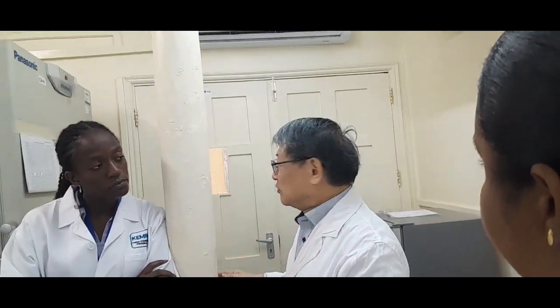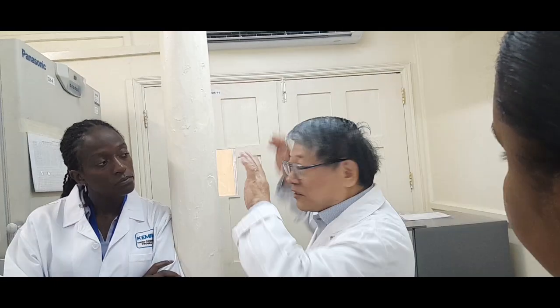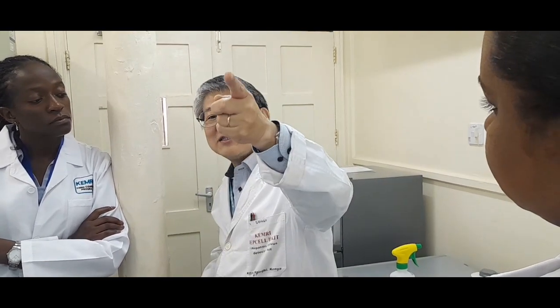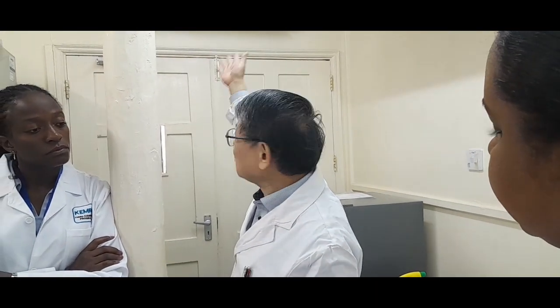Okay, not half capacity. Each one can cover this entire room, but we set the timer so that every 6 hours the operation changes. While this one is functioning now, that one is taking a rest. And after 6 hours, that one will automatically start running. So every 6 hours, the machine can take a rest, and the machine will not become overloaded. Okay? That's the first uniqueness.